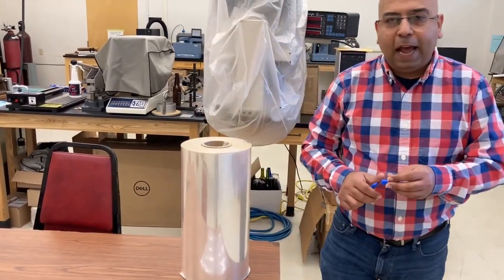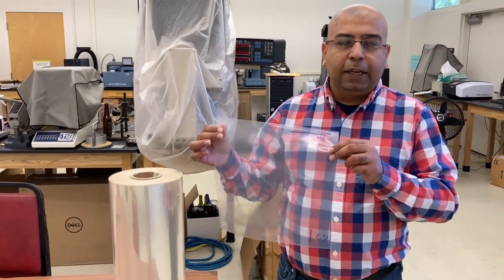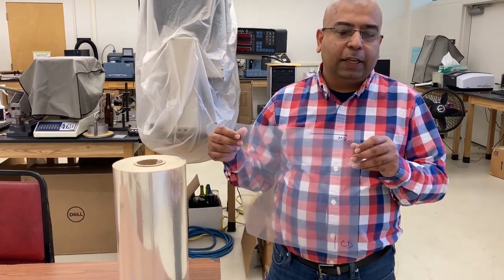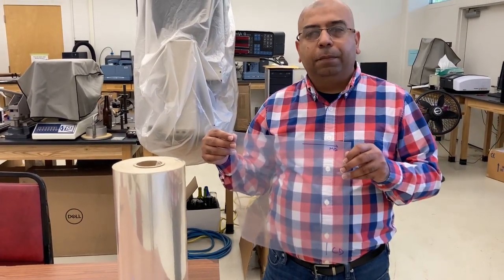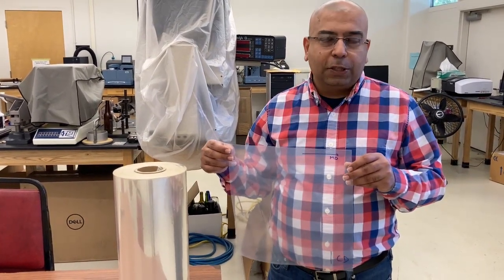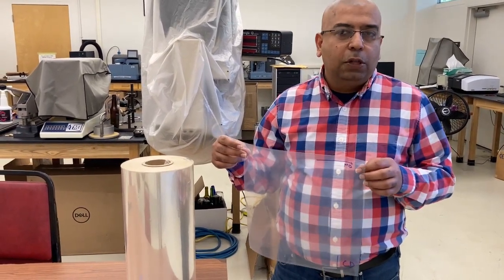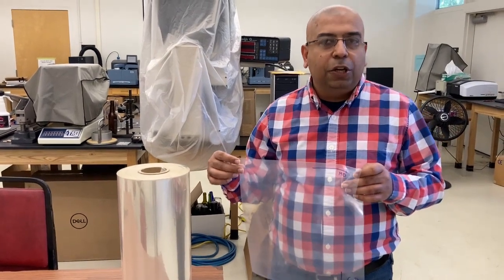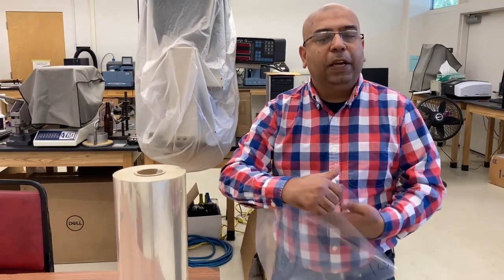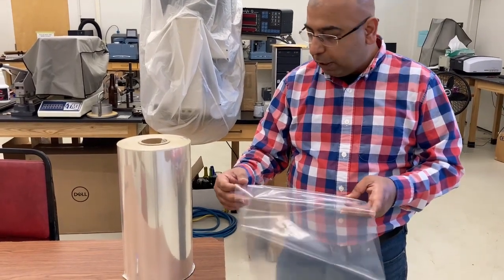The second thing that we have is to measure the thickness of the plastic film. We have to normalize for the thickness. Think of it this way: if I am stretching 2 mil or 4 mil or 6 mil film or sheet, the values, the performance of the material can change. So we normalize for the thickness, so we get a fundamental behavior or property of the plastic. We're going to learn about those kinds of things as well.